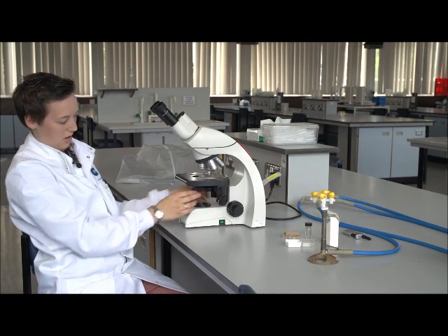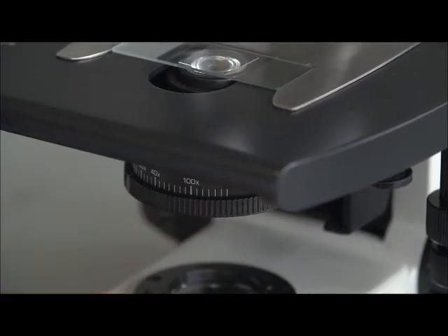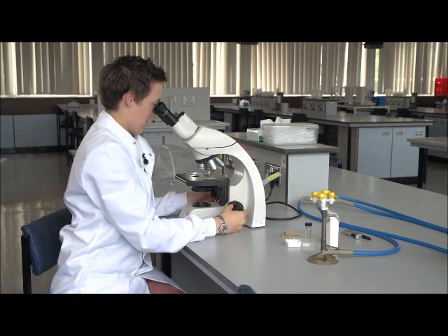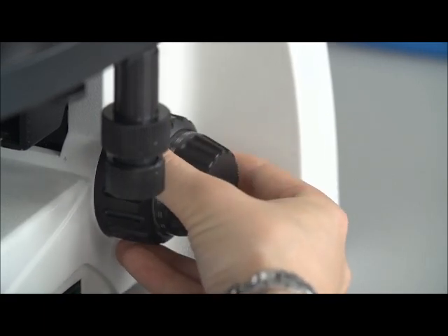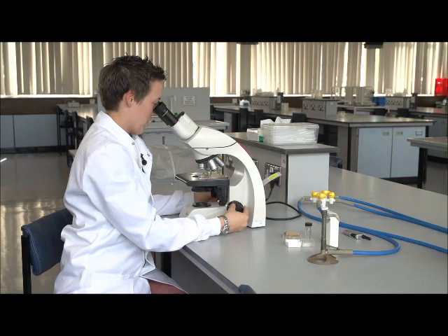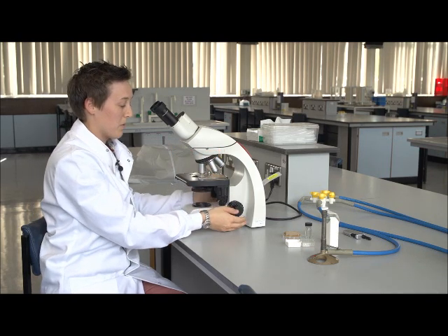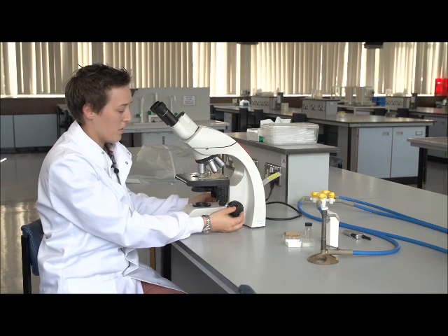We'll then check that our aperture is at the right level under the stage. We're set to the 4 times aperture for our 4 times objective. We then look down the eyepieces. Our light levels are fine. We now move down in focus to find our specimen and nicely focus on the specimen that we want to look at. Once we're happy with 4 times, we can then move up to 10 times. These microscopes are very good actually, and you should require minimal, very small amounts of focus change.